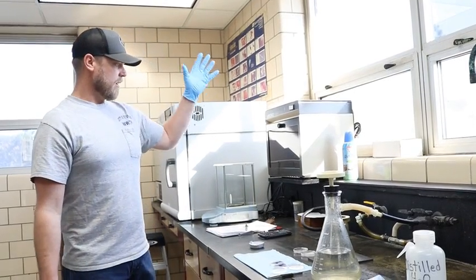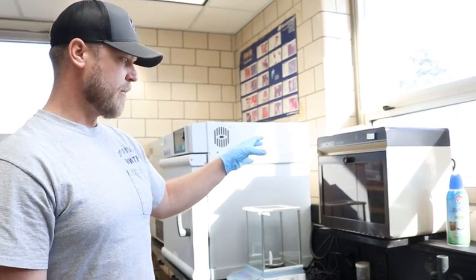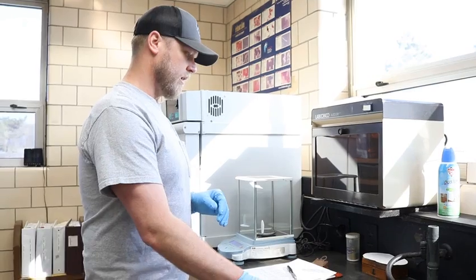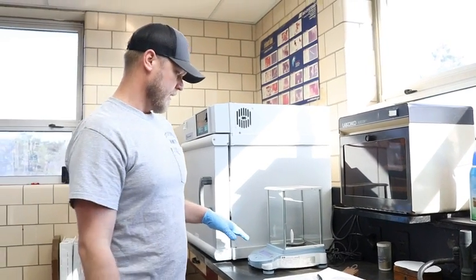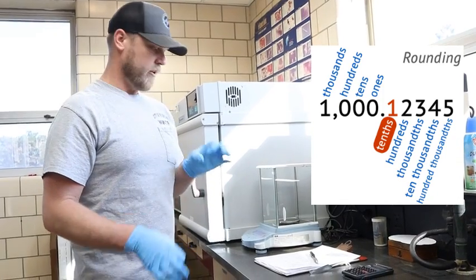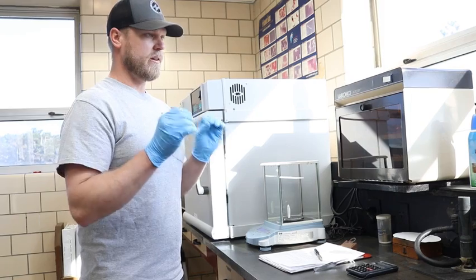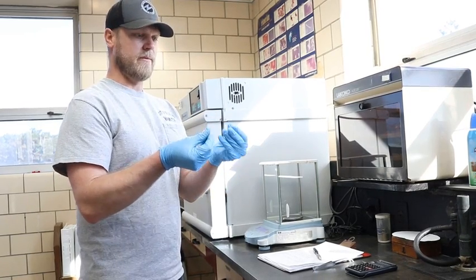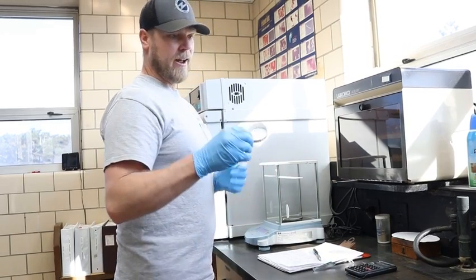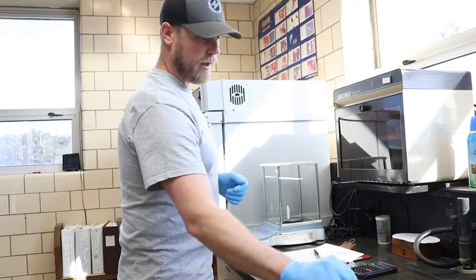This is our desiccator. This is basically for keeping any moisture out of our filters, because we are measuring in milligrams per liter down to the 10,000th of a gram. So we're very precise on what we're weighing, and any dust, any grease or oil film from your fingers can get stuck to these dishes, and it can influence the weight that you're getting out of your sample.